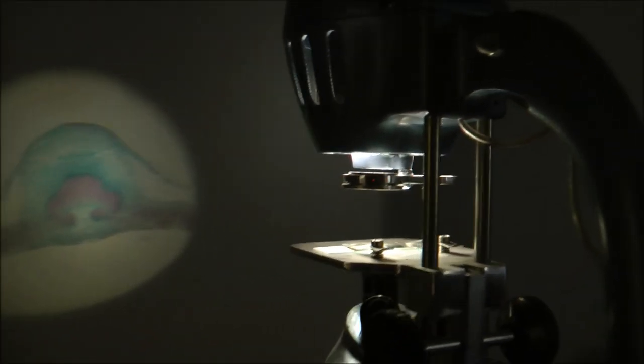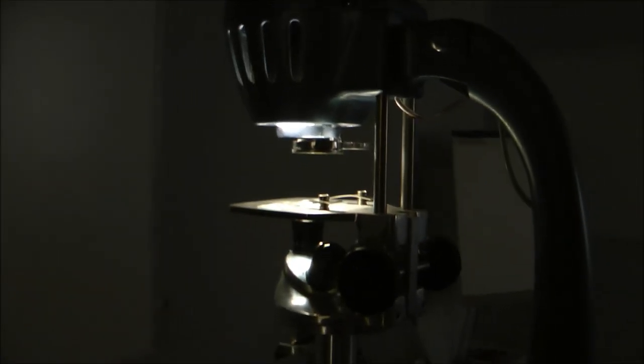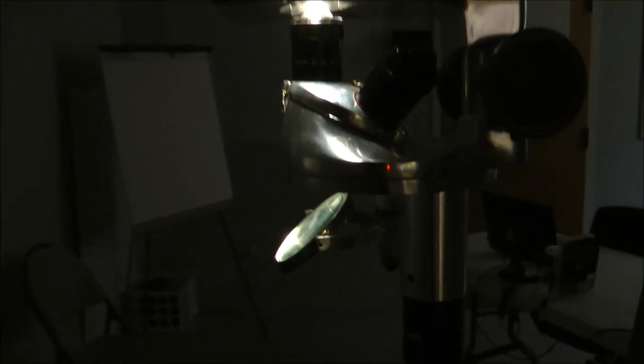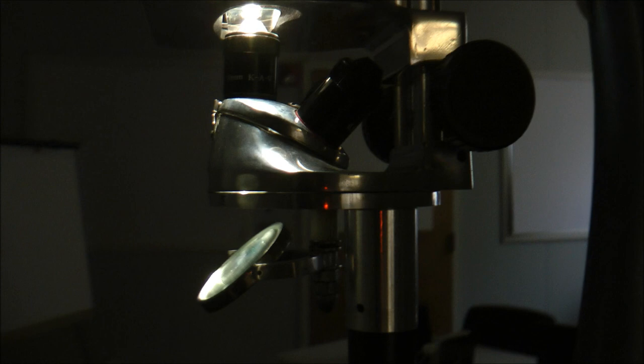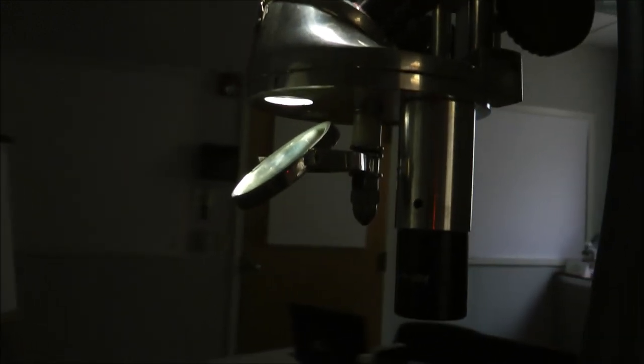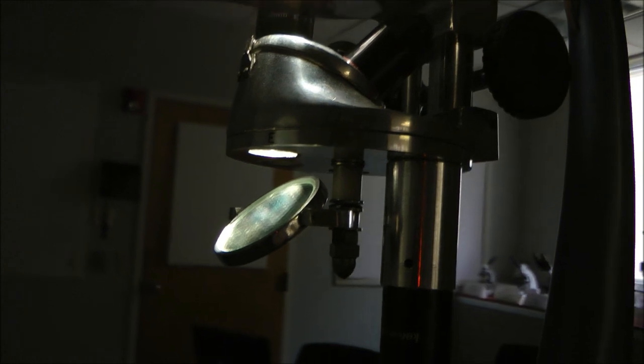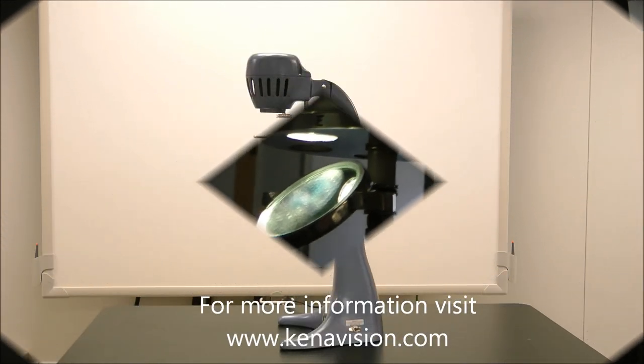You will do the exact same you have done. The only thing that you would change is you are going to actually have to position the mirror underneath the light source until you are seeing that reflection on your whiteboard. You then have the option, of course, to change your magnifications and focus on that specimen.